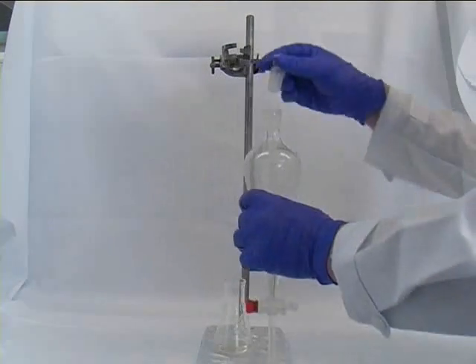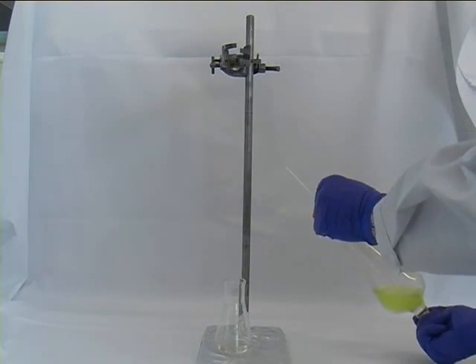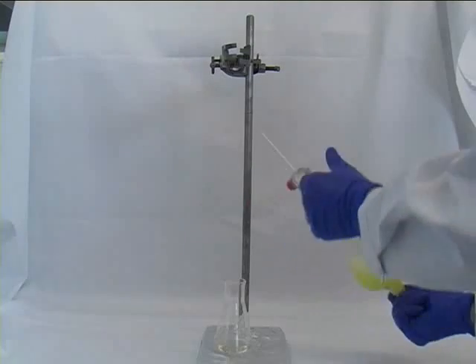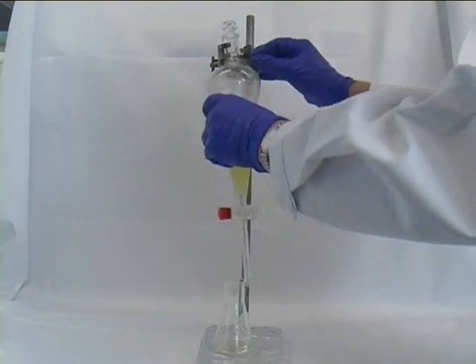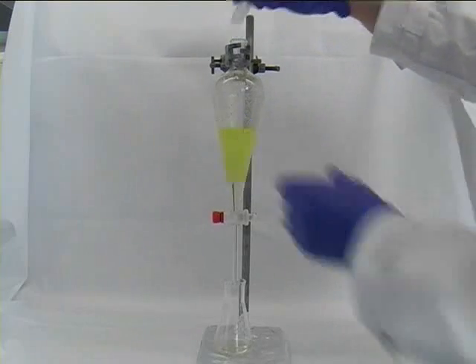Venting it in the process and clamping it back to the retort stand again. And again making sure that after we clamped it we remove the stopper at the top to avoid pressure.